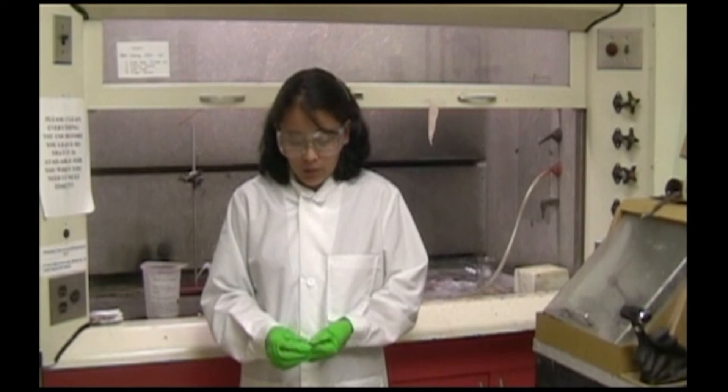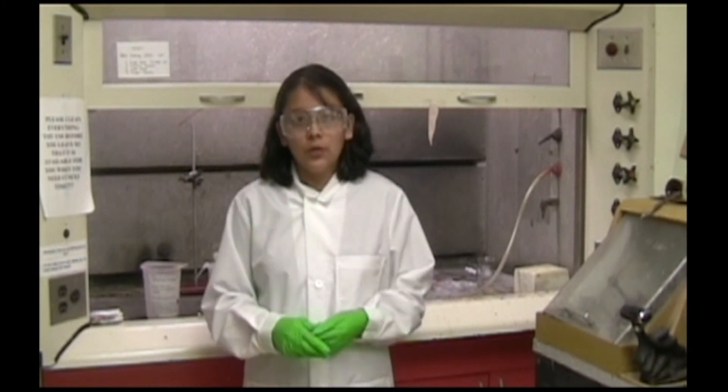If you are leaving the room, please take off your gloves and your lab coat so that you don't contaminate doorknobs or equipment in other rooms.